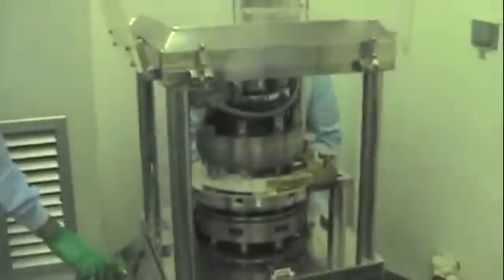That's the final step. Here we are doing the second compression of the tablets and we are obtaining a final dosage form. They are beautiful. Yeah, they are. Thank you.